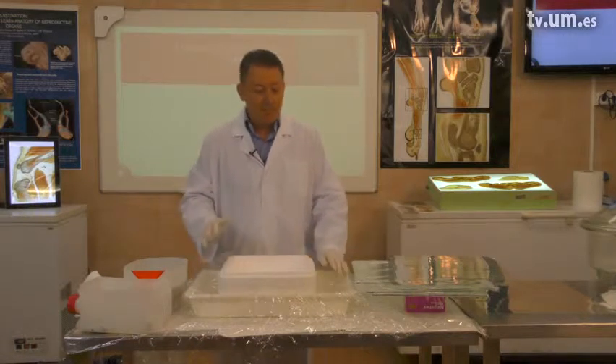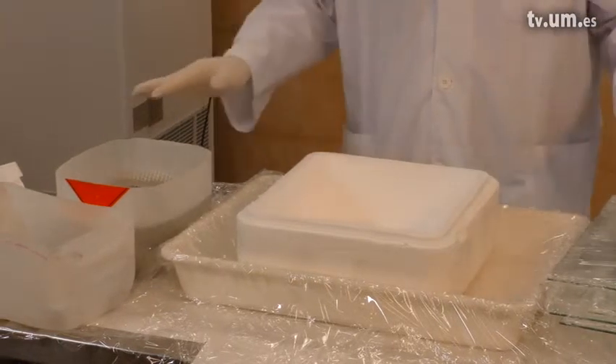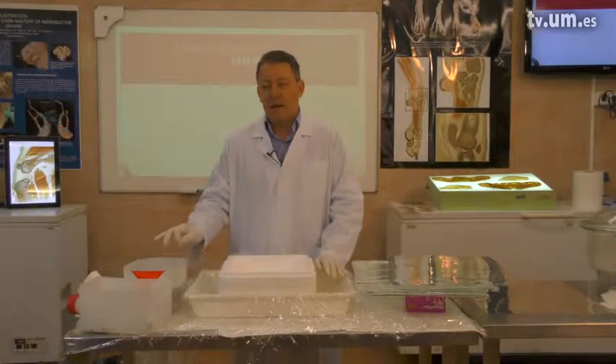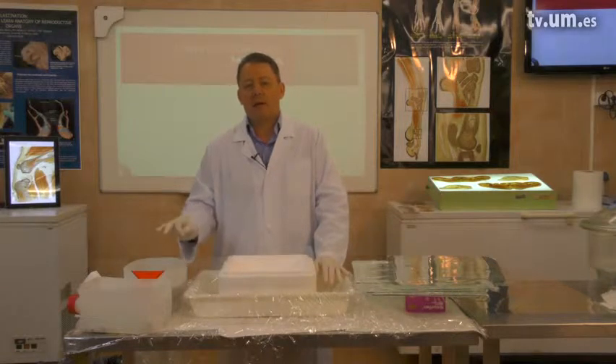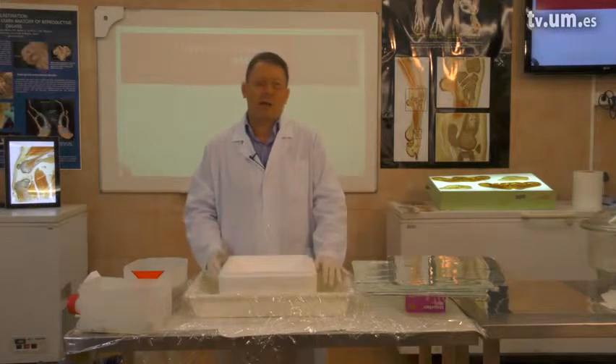Keep in mind epoxy is like a glue — it glues everything — so you have to have your table covered. Also keep in mind epoxy has an allergenic potential. That means don't get skin contact with E12; it could produce an allergy in some people.